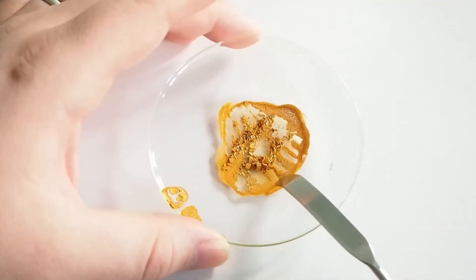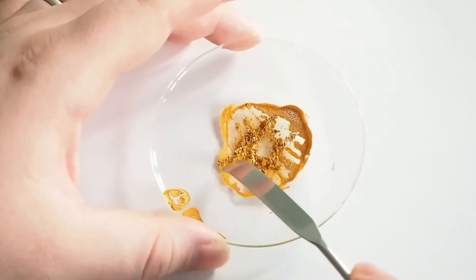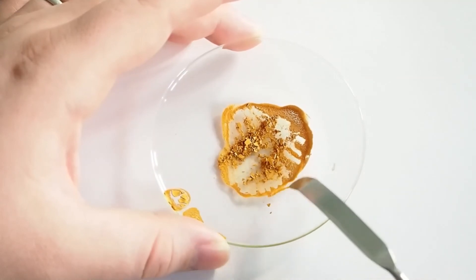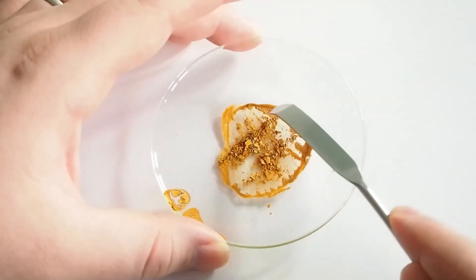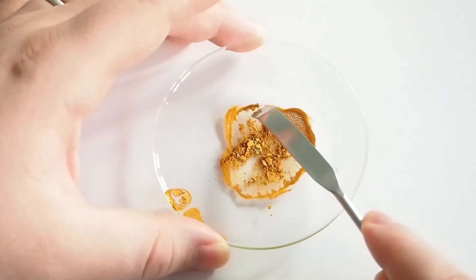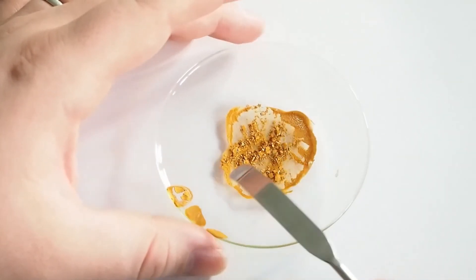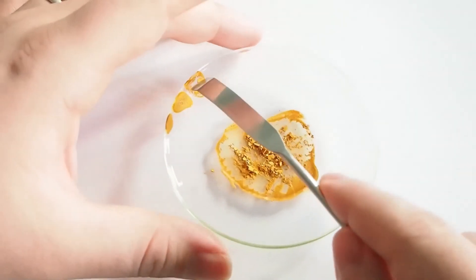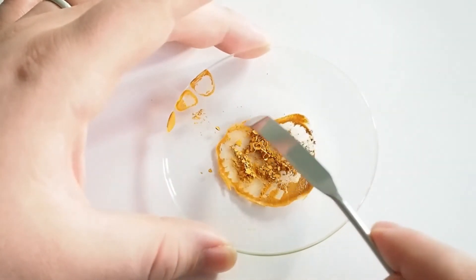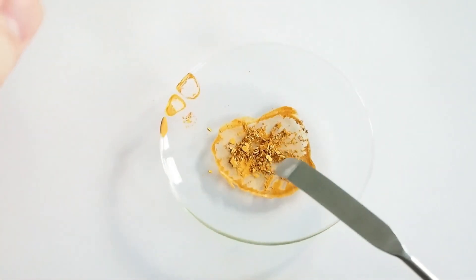You can see it's got this really nice colour — it's more of a yellow than a red. That's the thing I've really been enjoying about this iron chemistry: all the colours we can get. Because often chemistry, especially in organic synthesis, just ends up being white, or yellow if things aren't working very well. But this is working very well and very nicely. We'll just connect that together, and that's another sample for our iron chemistry.